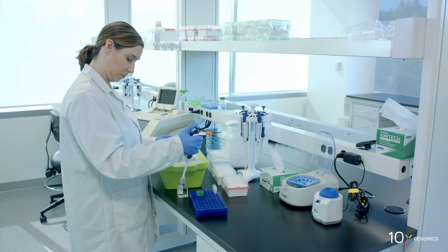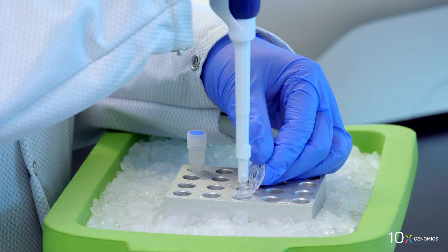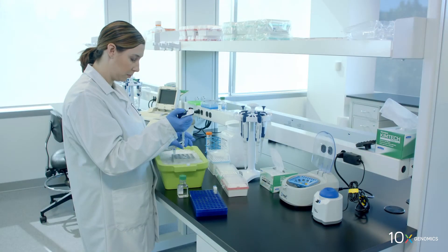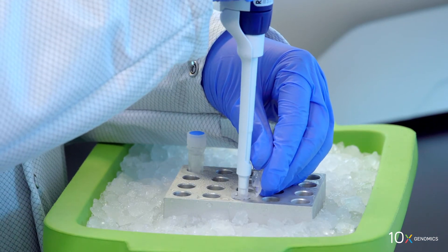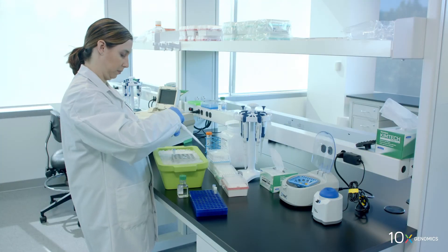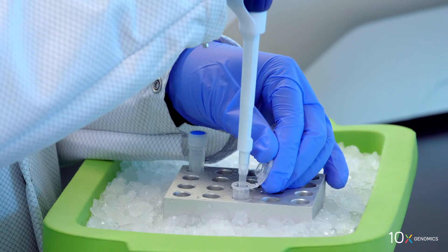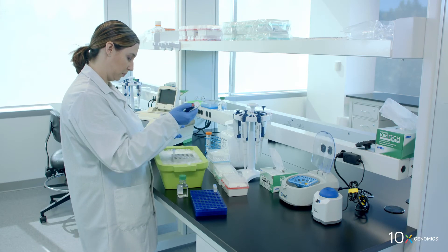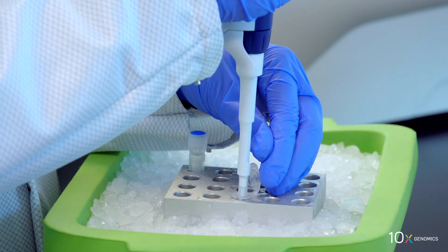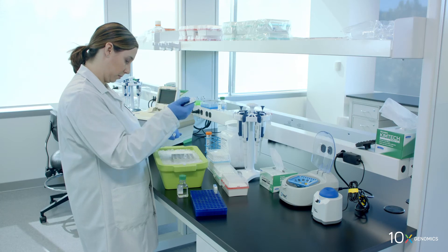First we add nuclease-free water, then RT reagent, then template switch oligo, then reducing agent B, and finally RT enzyme D.